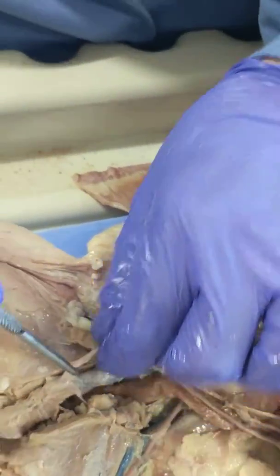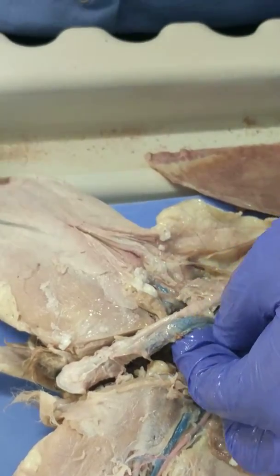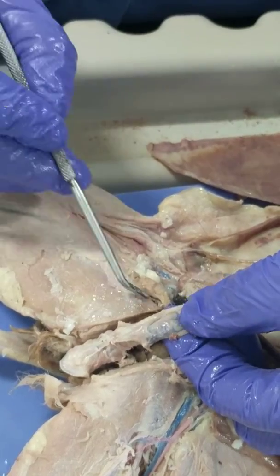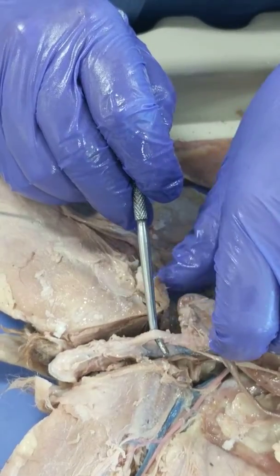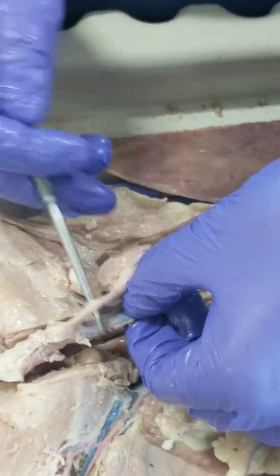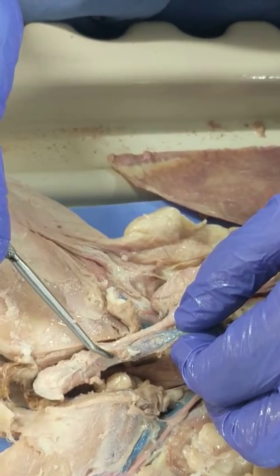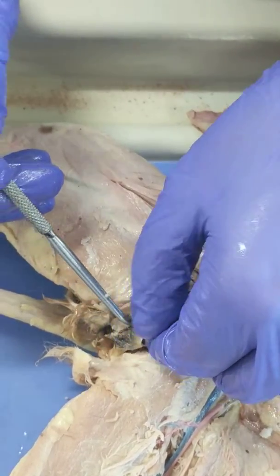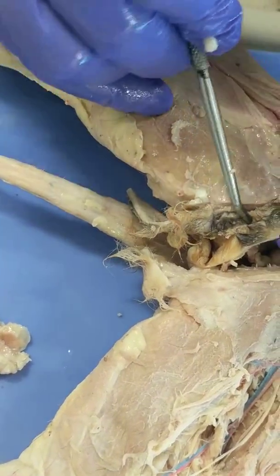The uterus actually thickens posteriorly into the vagina. So this is the vagina right here with a very muscular wall. The vagina and the urethra from the urinary bladder unite — can you tell that they're joining right there? They join in the urogenital sinus.